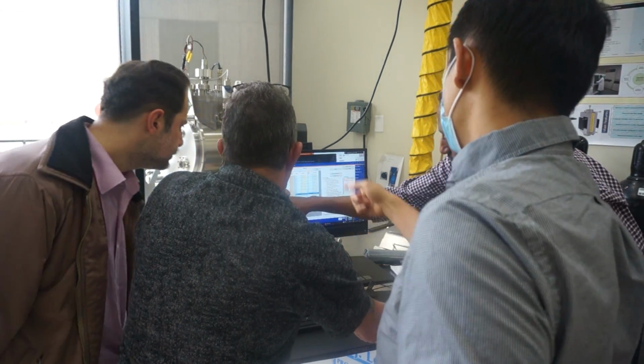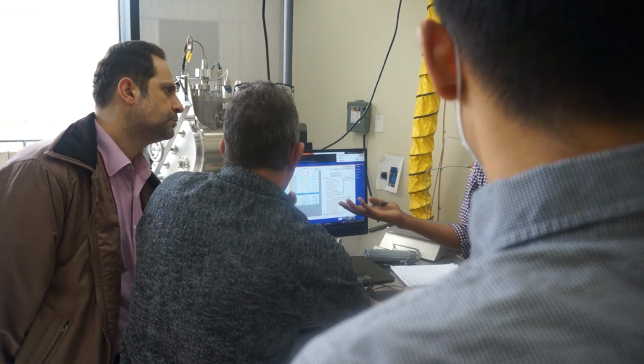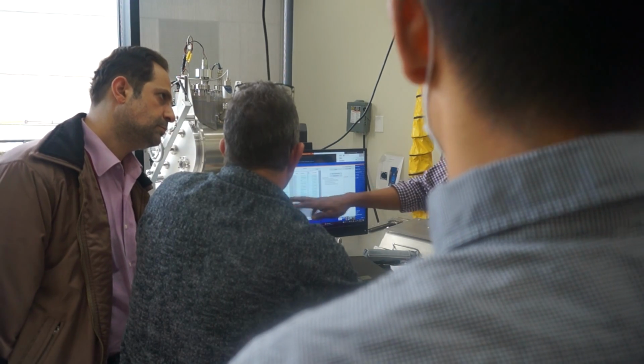Now we have the recipe, TMA plus H2O. So if you have a new recipe, automatically the name will be changed here.